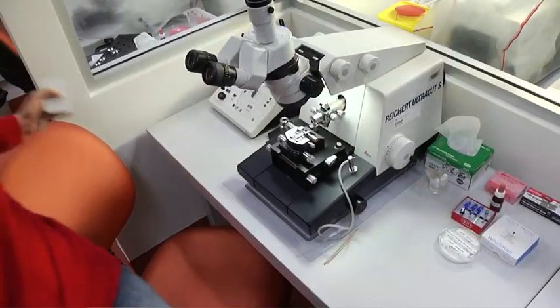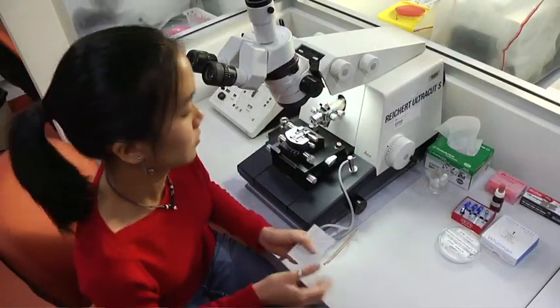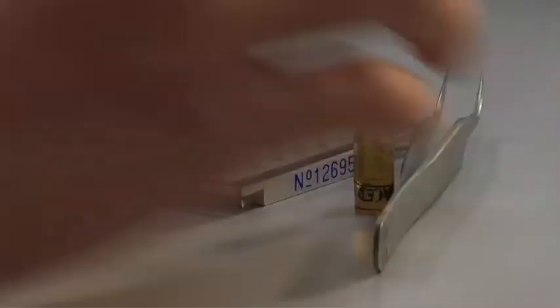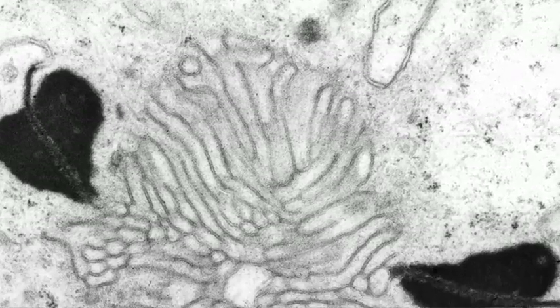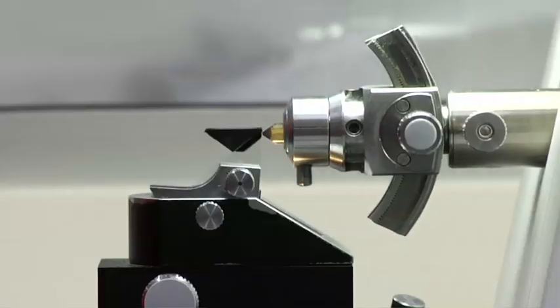One of the main challenges in sample preparation for transmission electron microscopy, TEM, is to produce electron transparent samples suitable for imaging. This video demonstrates how an ultramicrotome is used to cut thin sections for TEM.